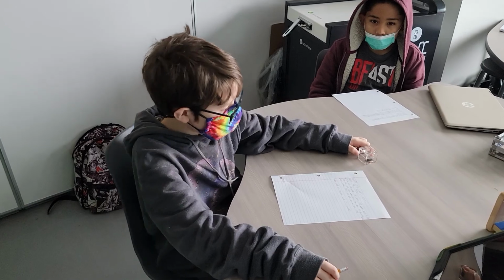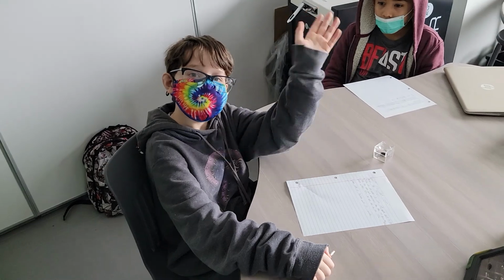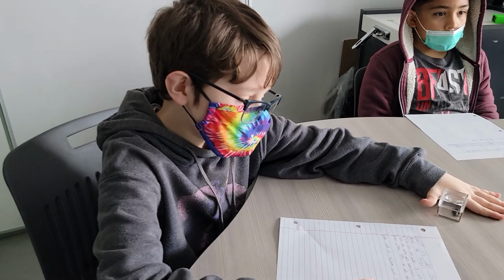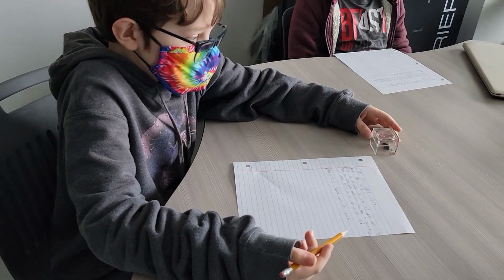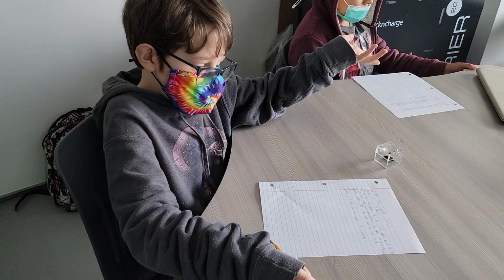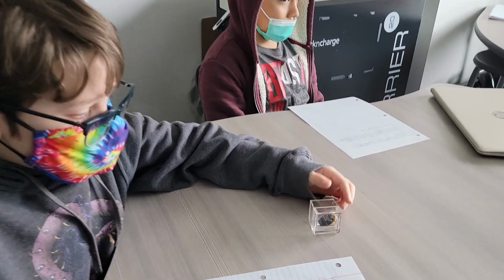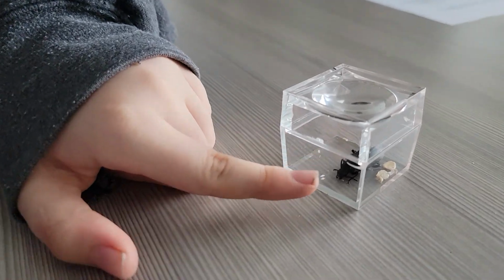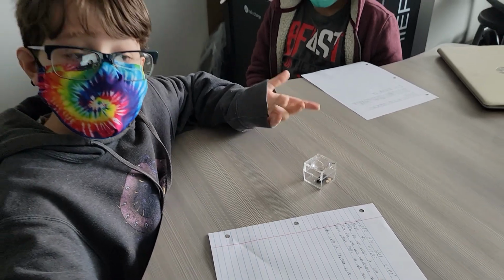All right, we have a new friend that joined us from online, and he's now face to face. So now he is a part of the YouTube family. Let's talk about your findings: what does it eat and what type of protection does it have? It eats grains, carrots. But the type of protection that it has, it uses its carapace, as you can see right there, and that's because they fight a lot.